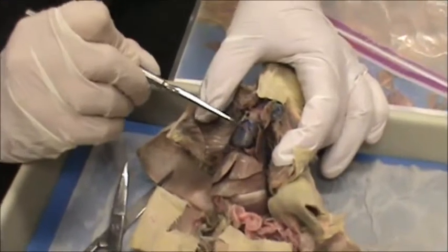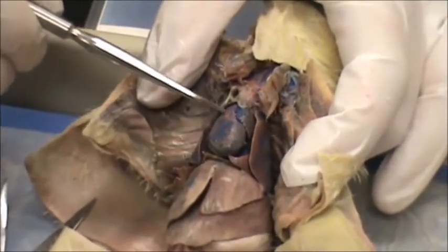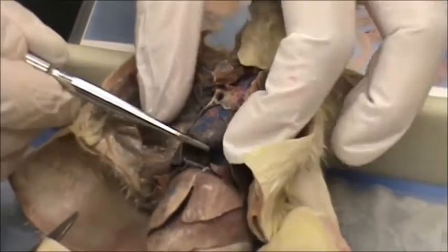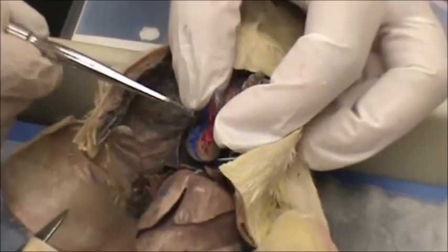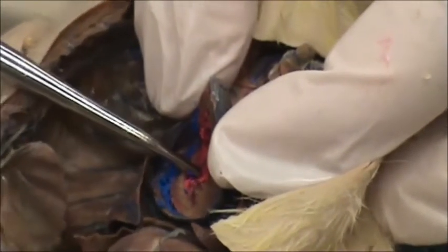This is the heart, and on the heart you can see these red and blue blood vessels. These are called coronary arteries for the red ones and coronary veins for the blue ones. I cut open the heart, and internally you can see the right ventricle and the left ventricle. Deoxygenated blood is indicated by blue and is on the right-hand side of the heart, and the red indicates oxygenated blood on the left-hand side.